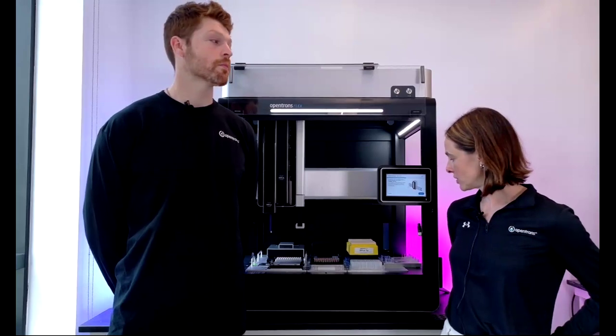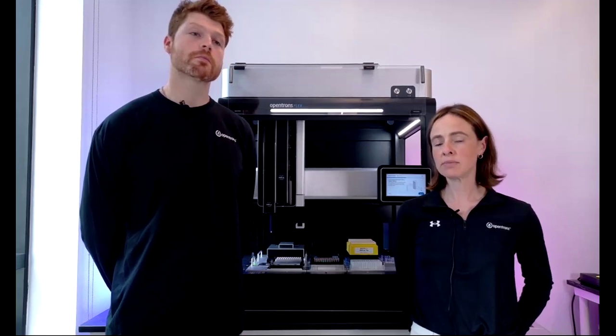Guillaume, is it easy to adapt protocols to different plastics? Yeah, this is a great question. We have a labware library, which has all of the dimensions and specifications of a piece of labware. It has a lot of existing labware spec'd out in it. But you can also create custom labware, where you can create essentially any configuration you like. It just involves entering the specifications that determine the height of the plastic, the width of the plastic, where the wells are, and so on. So there's a lot of optionality for different labware.